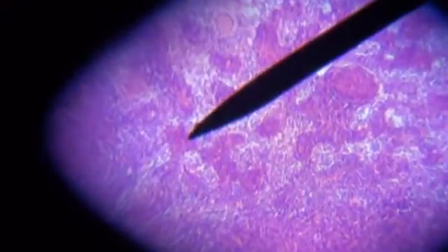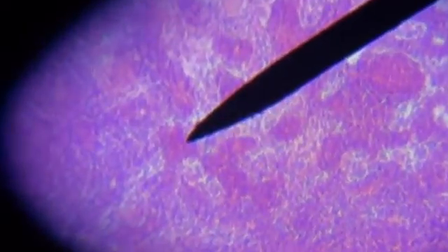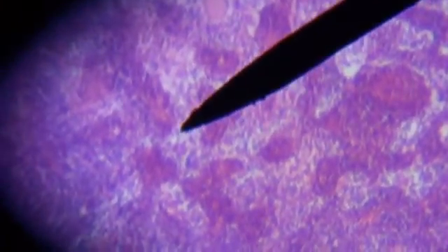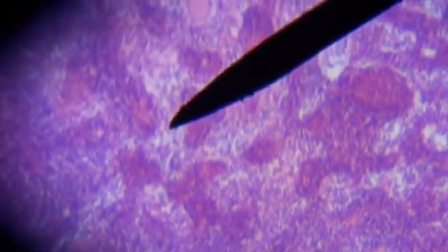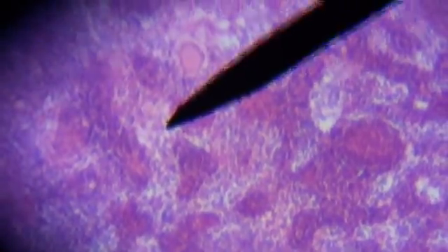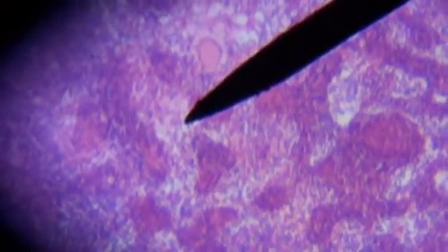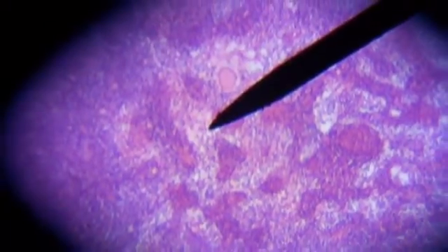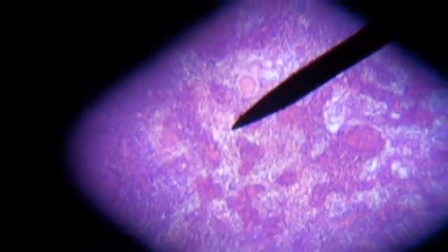Now I'm going to show you the medulla. The medulla is this lighter portion — you see all of that? That almost looks white in the center. All of that light area, not the dark spots, but the light area is called the medulla.